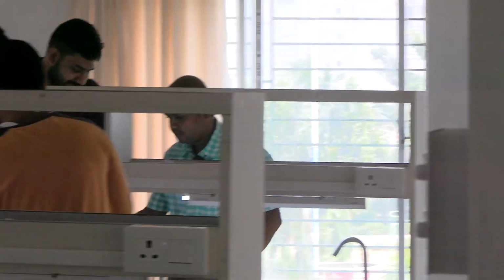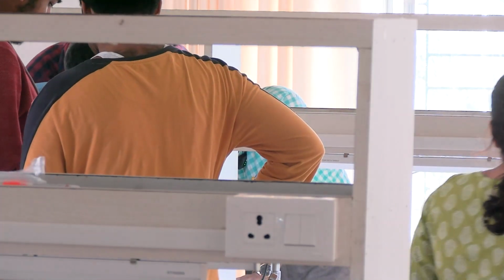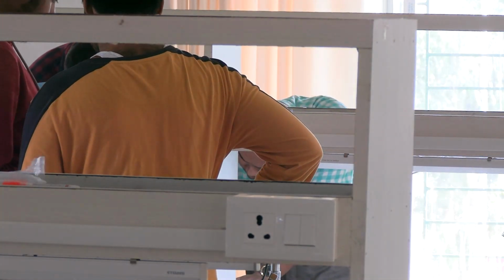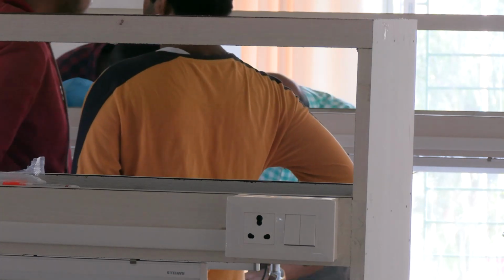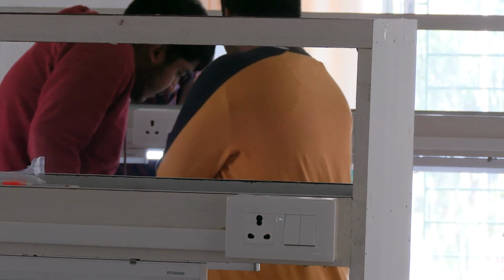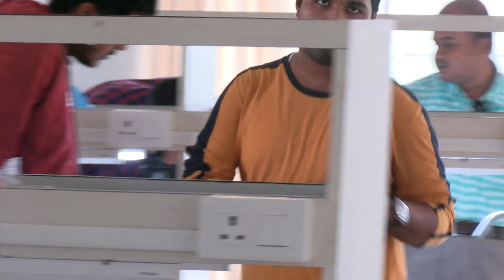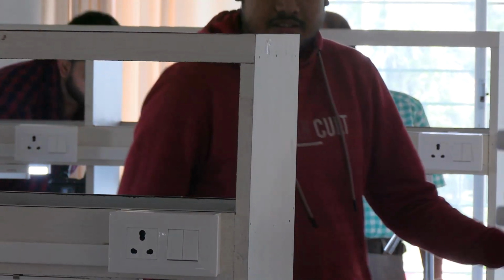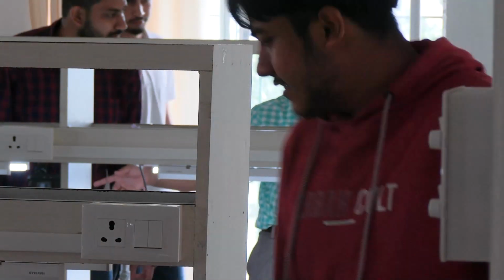Not able to focus it. This is under which power of the microscope? 5x. Why are you doing under 5x? You may do, but no need. Start from 10x. So this is where you are focusing. Usually, this is a parfocal system of lens. If you rotate it to other lenses, the focus should not move away.